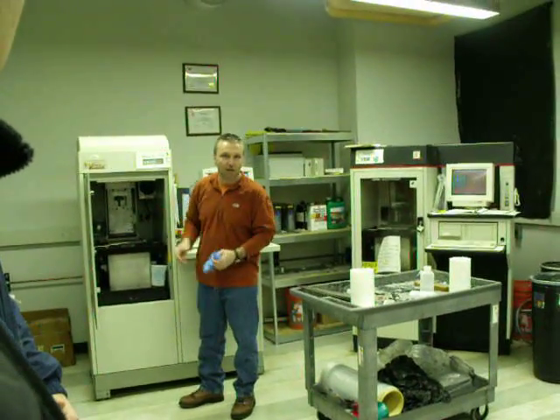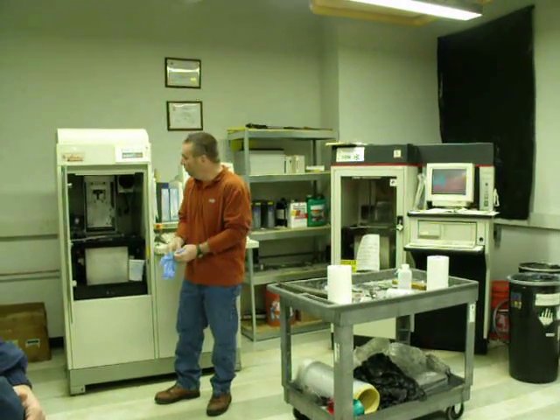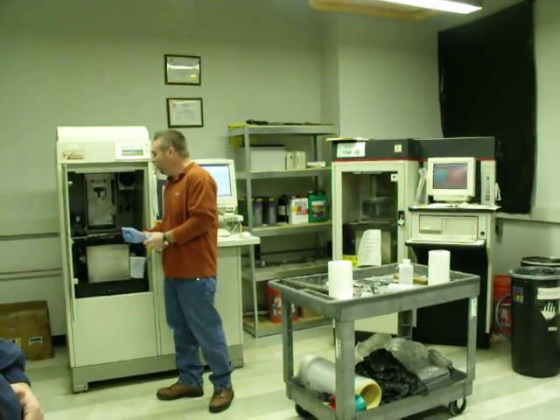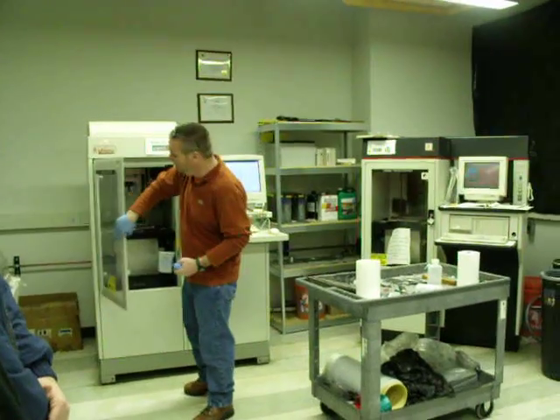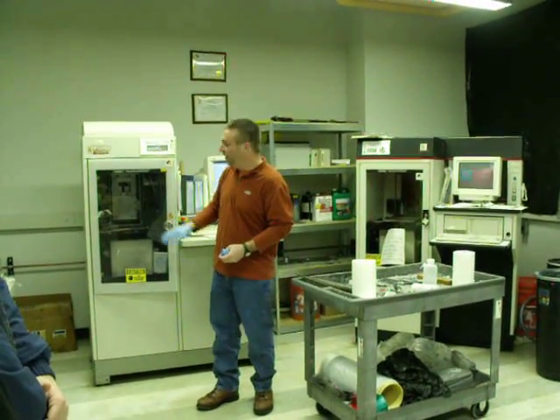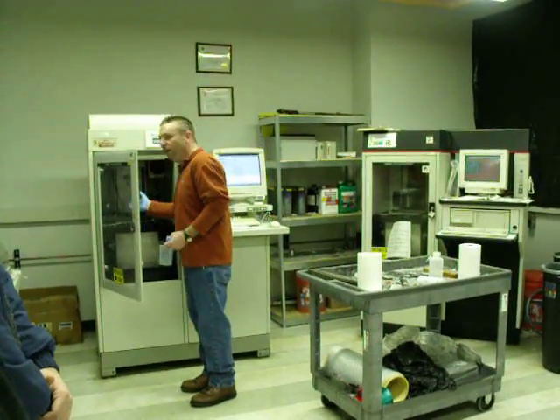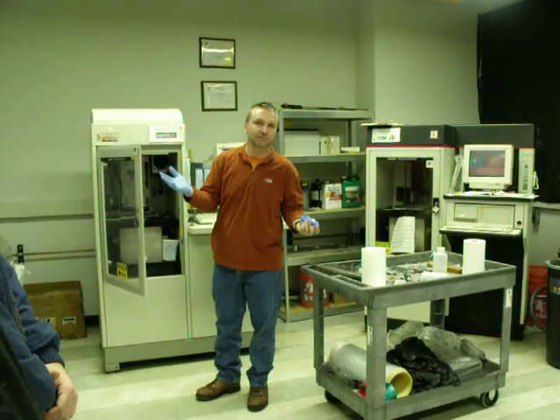Gloves on. When you're working and you're removing platforms, you're doing whatever it is you're doing, and you've got your gloves on, I don't want to see anyone doing this. All right? Because all you're doing is taking what was on the inside and now you're putting it on the outside. So when you're working on the inside, okay, a lot of times I would just use one glove.